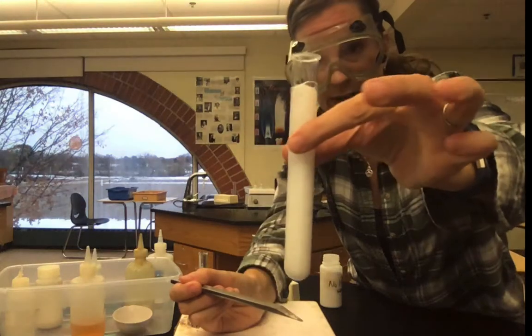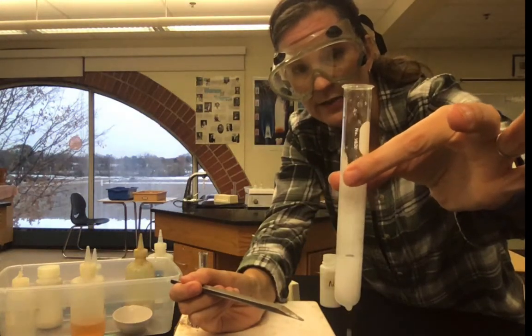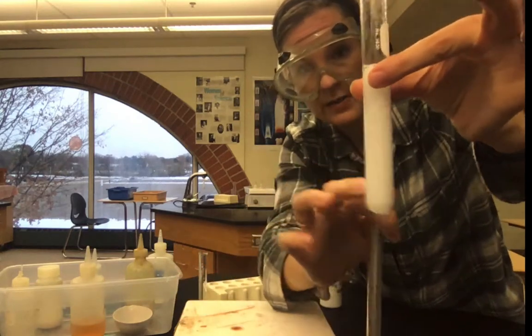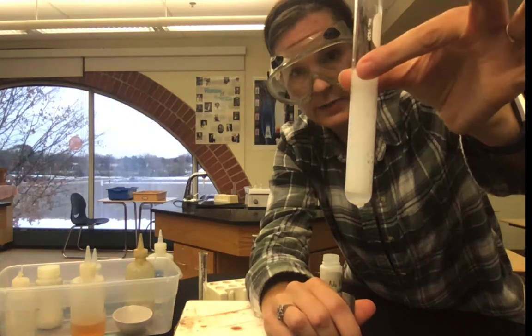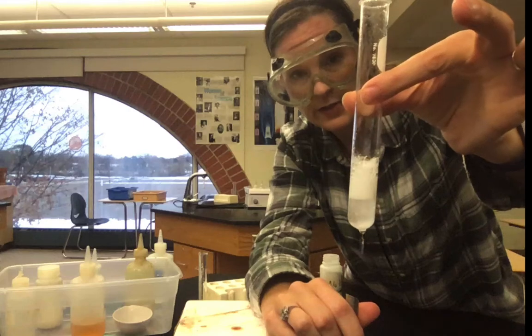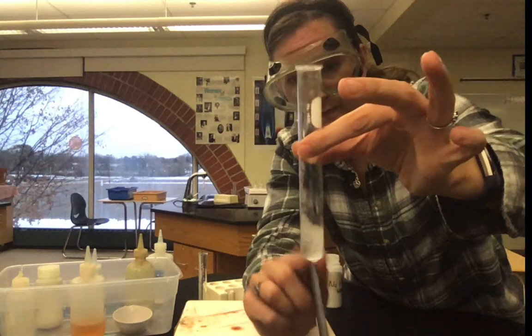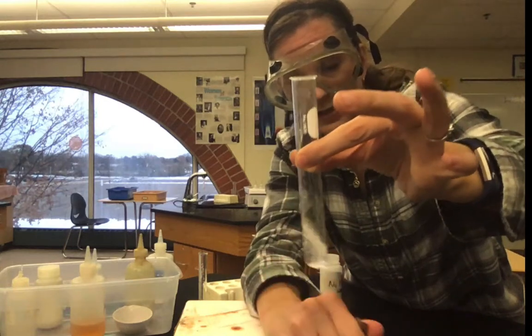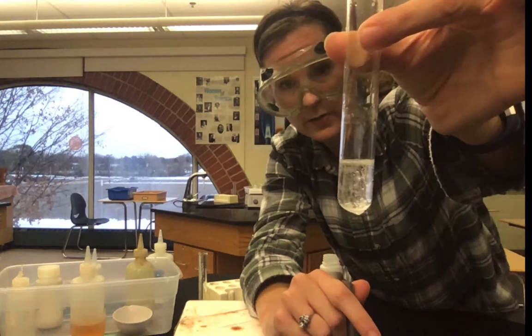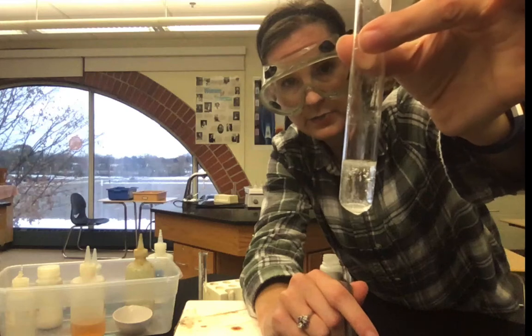As I allow those to react, we're seeing some clear signs of the changes that are occurring. So make sure to record what observations you're making in relation to this reaction. And oftentimes it's beneficial to even see the interaction after it's over. So if we wait for this to settle down, you can sort of see where we end up. Still have some bubbles being formed. Kind of looks like Sprite right now.